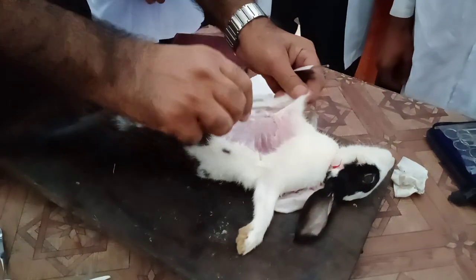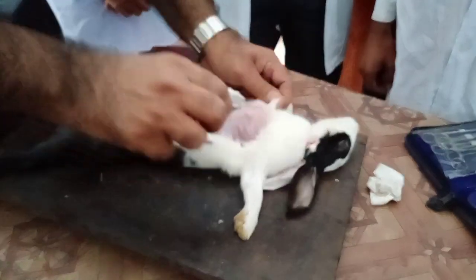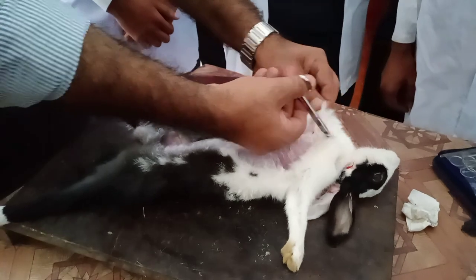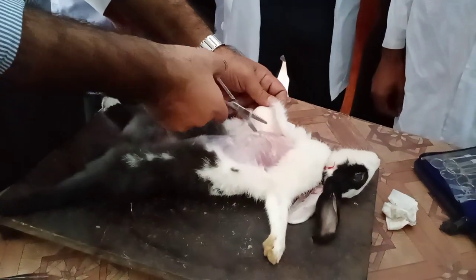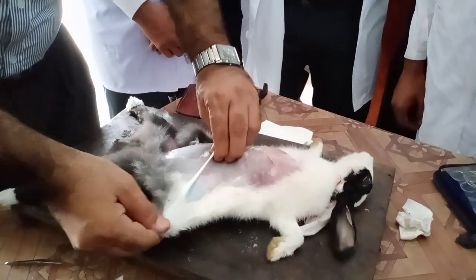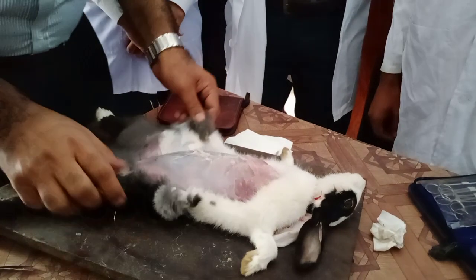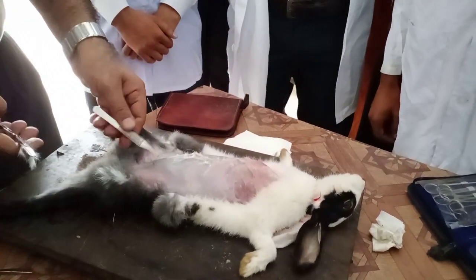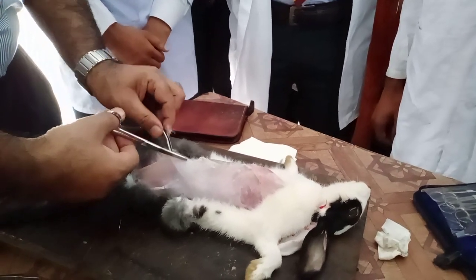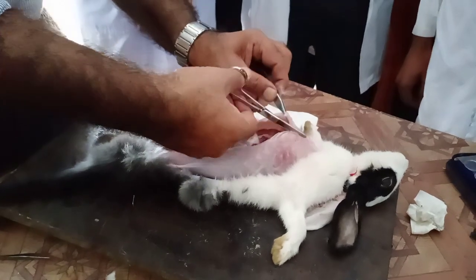Take the other forceps. This is how we have to remove the skin. This is the best thing that you have to do as early as possible. Use the body wall — this is the body wall and you can see here the body cavity.